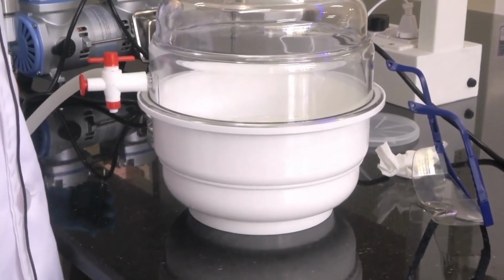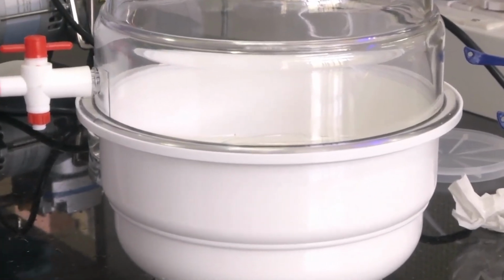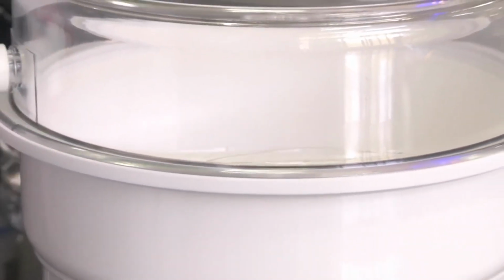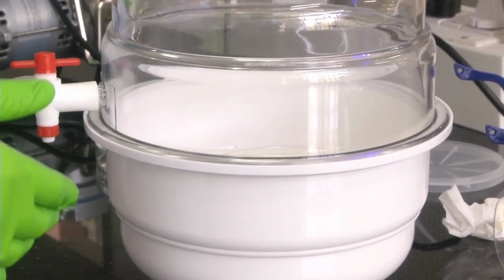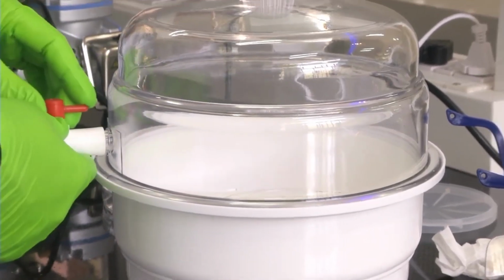They form a thick air bubble area, like when you open a fizz drink, a carbonated drink bottle. When you open, you will see all the bubbles coming to the surface, right? Like that, these bubbles will come to the surface, and as we continue taking air out of the desiccator, these bubbles will start escaping from the surface. So over time, all the bubbles will escape from the bulk of the liquid and from the surface of the liquid, and eventually the liquid will become very clear. Now we will take out the liquid and see how clear it is.